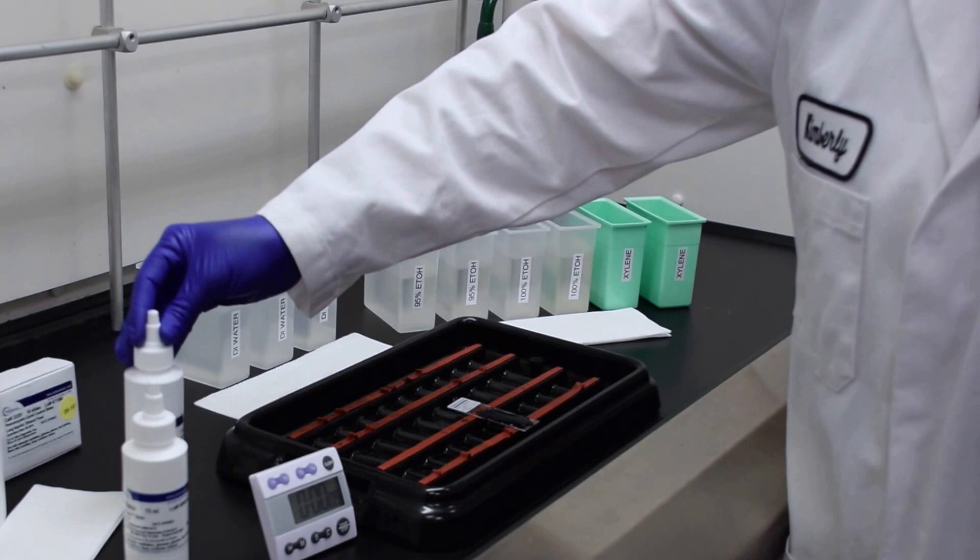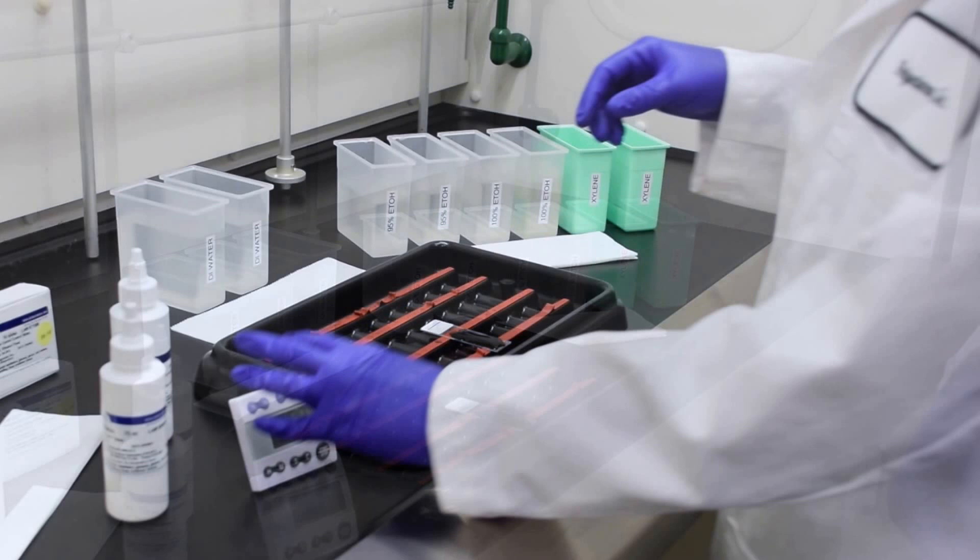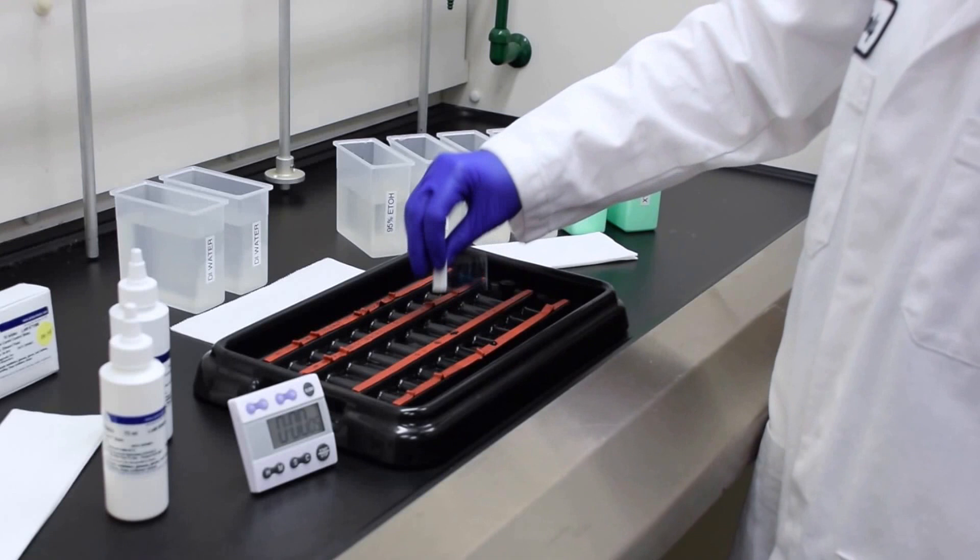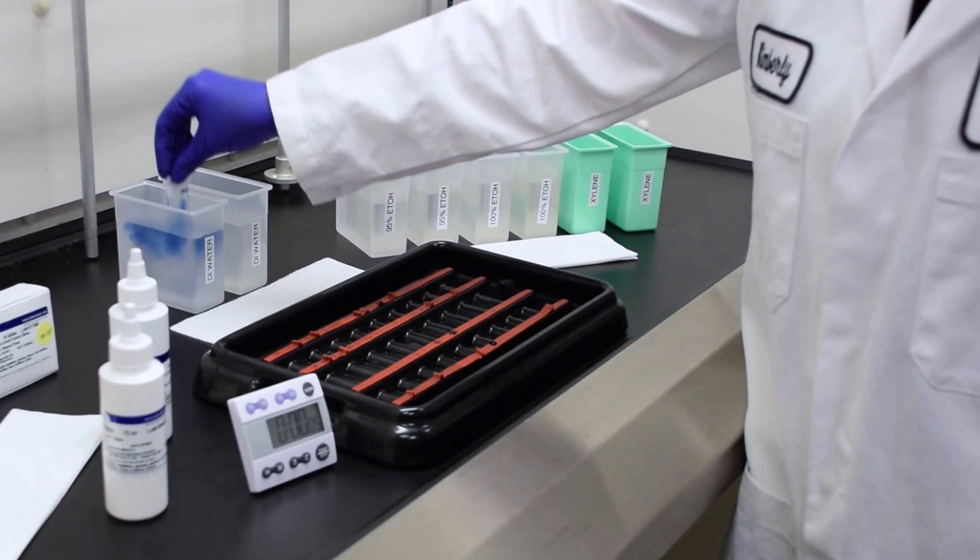Stain for one minute. Now gently drain off the counter stain, solution B, and transfer to DI water to rinse for about 15 seconds.